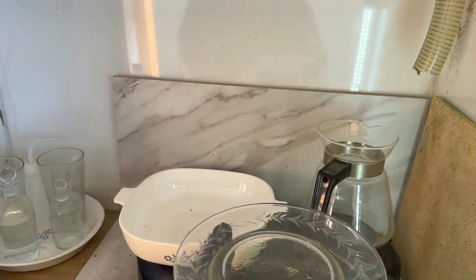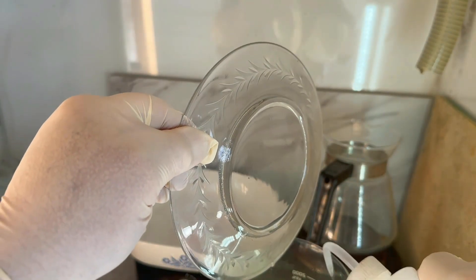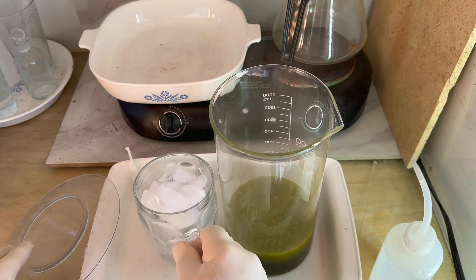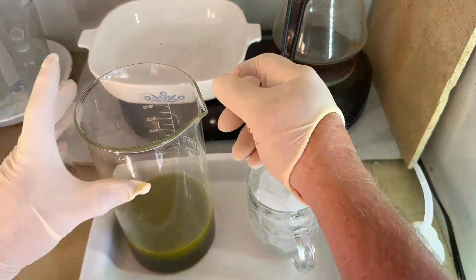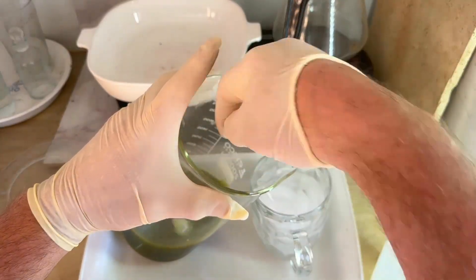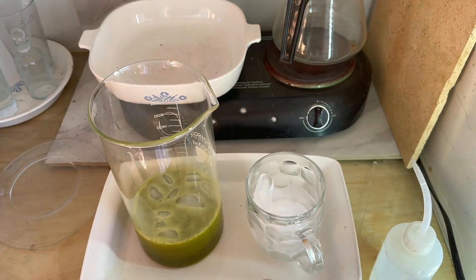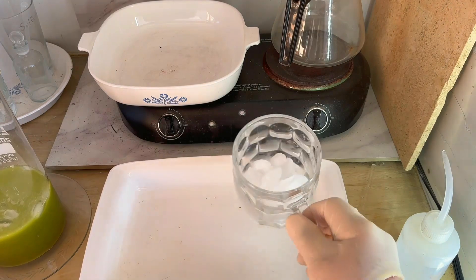Pulling it off the heat — I think we're done cooking with the aqua regia. We're going to cool this down by adding ice, which will both cool the solution and precipitate any silver chloride that might have come across from the karat gold on our gold-filled jewelry. As we stir, we can see that layer of silver chloride forming, and we'll definitely need to get that filtered out.